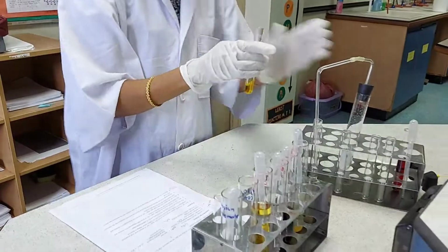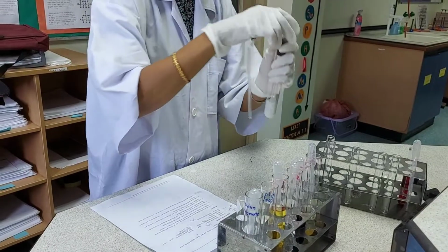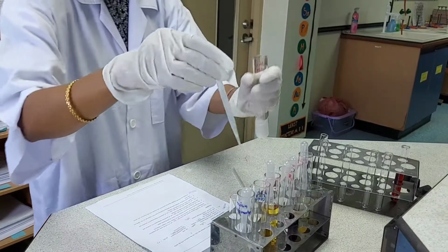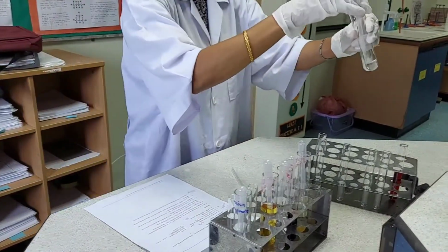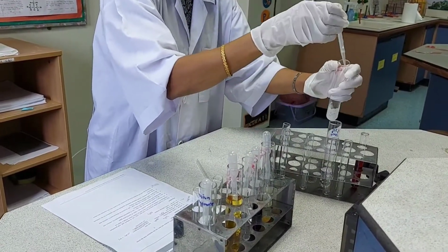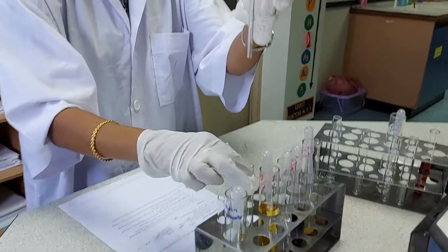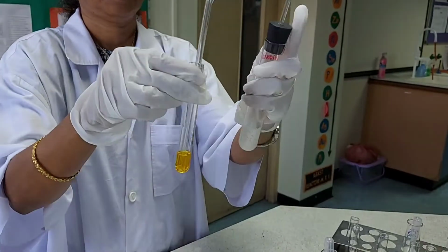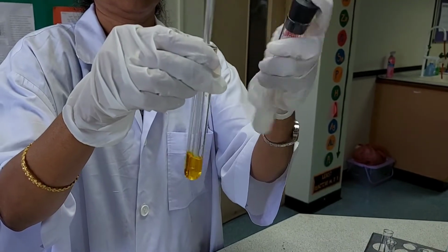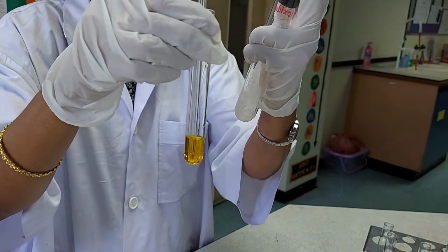Okay, and then bubble the sulfur dioxide water.